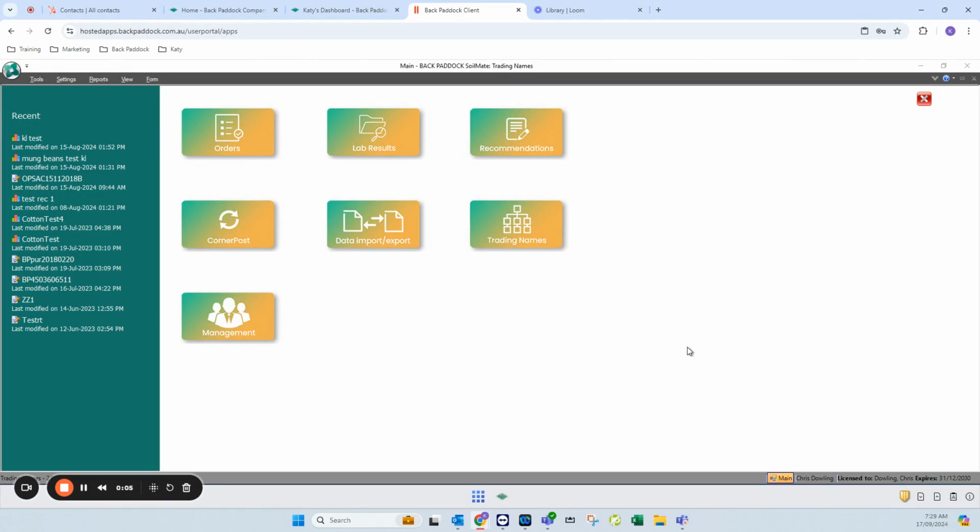Today we're going to look at adjusting our sample order when we've made a mistake to change things like sampling depths and paddock details. So all of this can be modified in the order at any stage. So if you have submitted some samples to the lab and they've been tested, and you've just realized that maybe you've entered it as 0 to 10 and it should have been 0 to 15, or you've assigned an incorrect paddock, this is all very fixable.